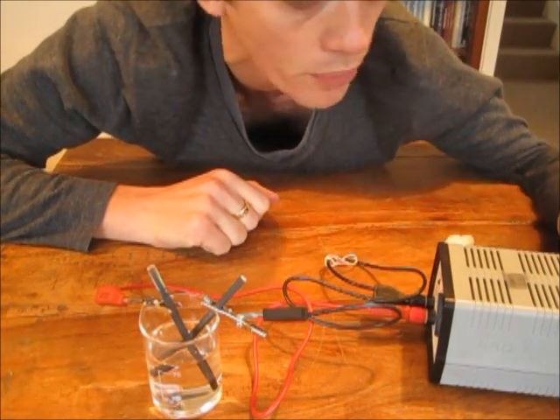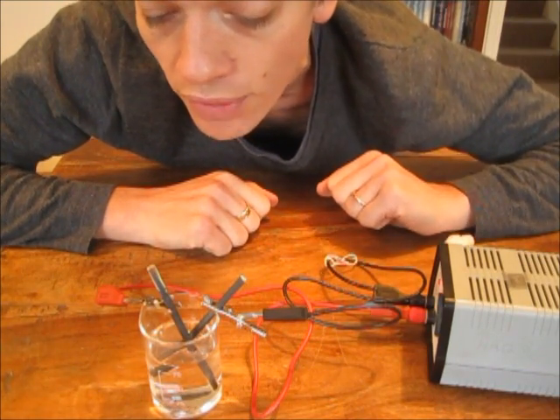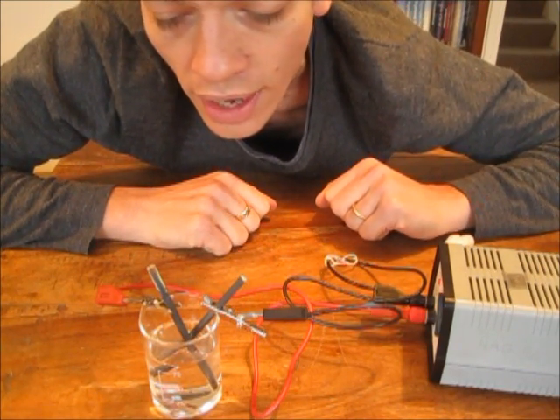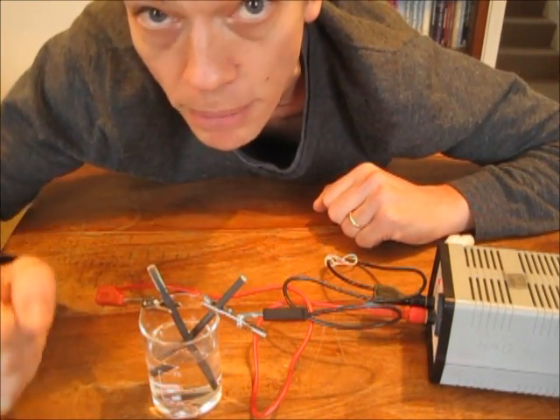What I'm going to do now is turn on the power and we're going to see what happens. The power is on and I have fizzing at both electrodes. Both electrodes I see bubbling.